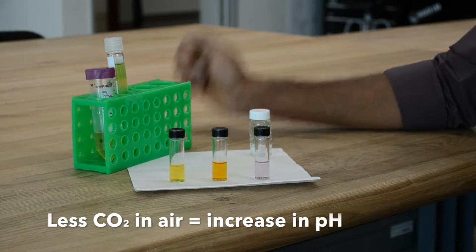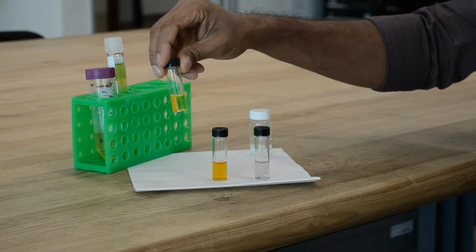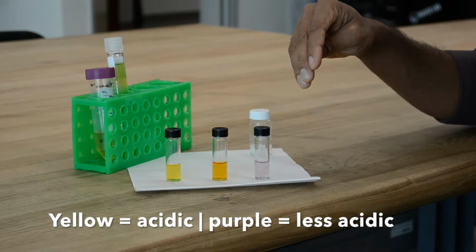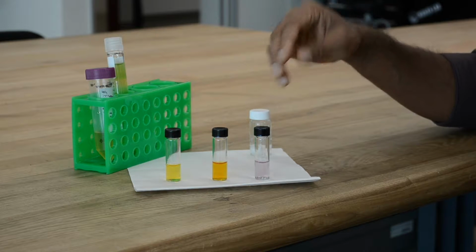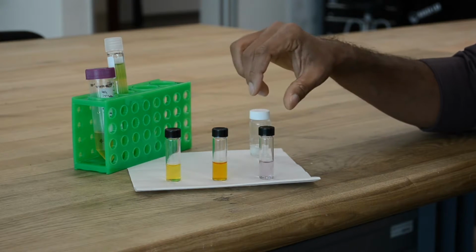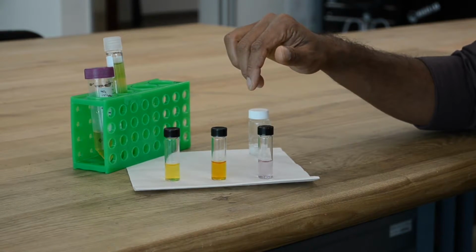So over here, we have the solution when the CO2 has not been captured, so you can see a bright yellow color. And as we proceed to the left, more CO2 is being captured, and that leads to a change in pH and a purple color. And therefore, we can use the bicarbonate indicator to study algae-based photosynthesis and conversion of CO2 into oxygen.